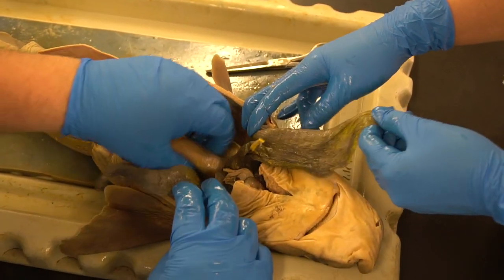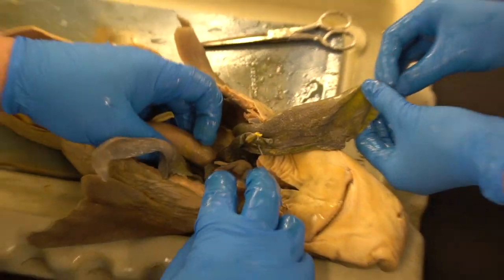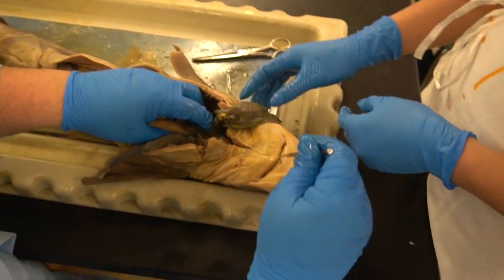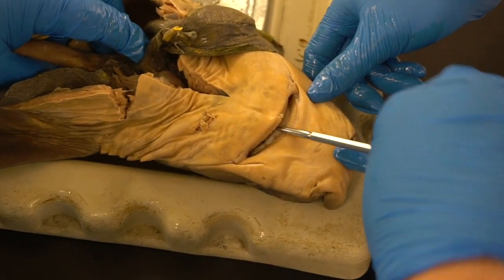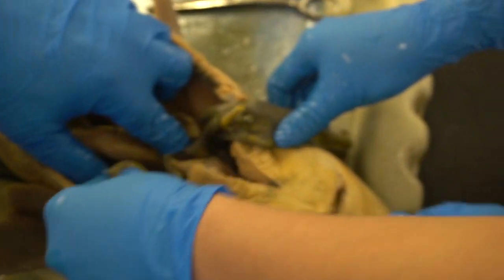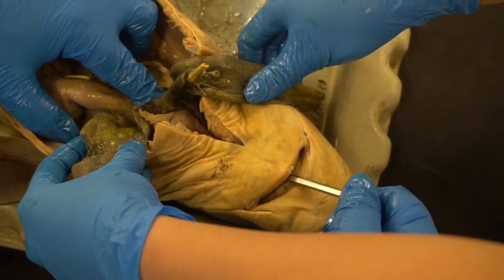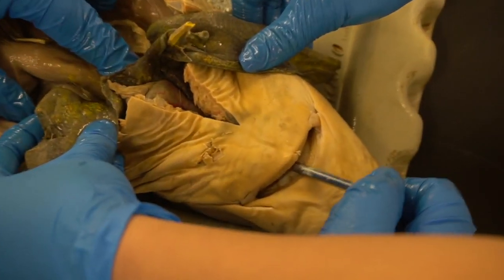All right, I could trace that if I took a probe. Give me a blunt end probe. If I enter into the mouth and I push the probe in, just like we saw with the perch, if I push this down the middle, I could feel, as I push up on this, it hitting at the top end of the stomach, or the cardiac end of the stomach. Okay, that's right down the middle. I feel the probe pushing up on my finger.